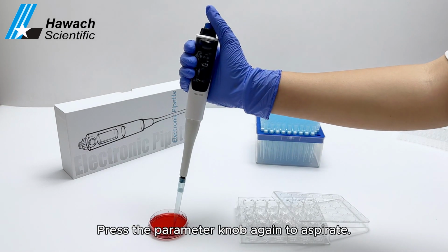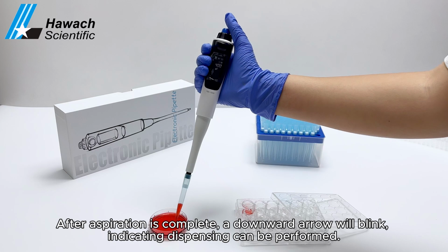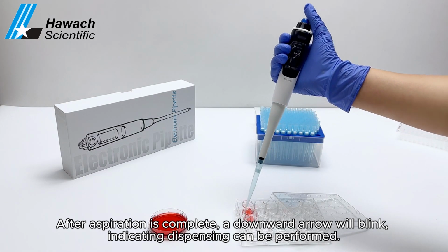Press the parameter knob again to aspirate. After aspiration is complete, a downward arrow will blink, indicating dispensing can be performed.